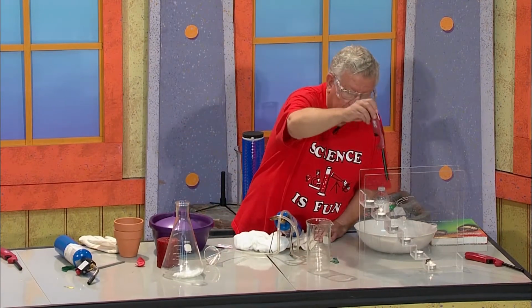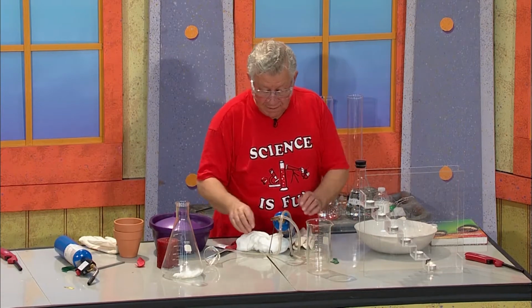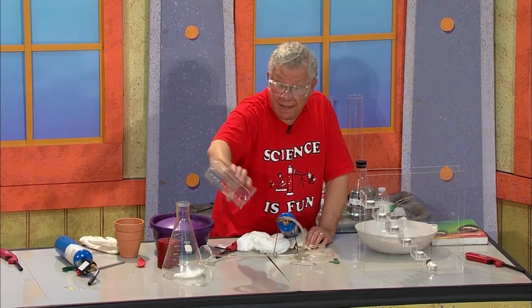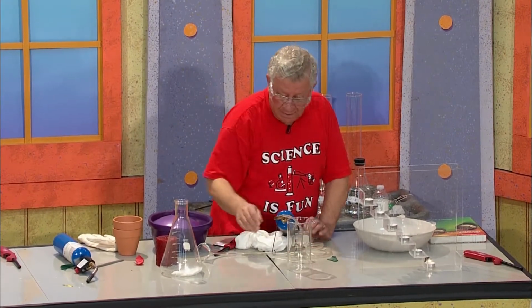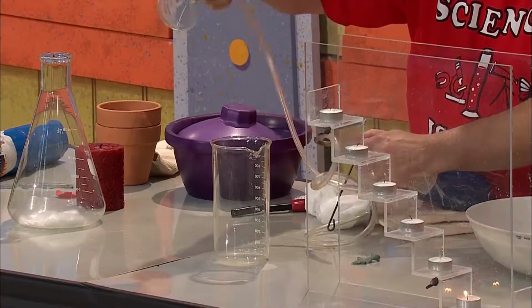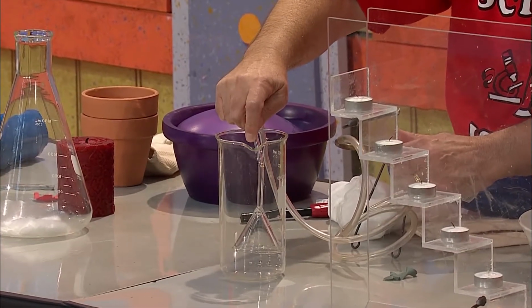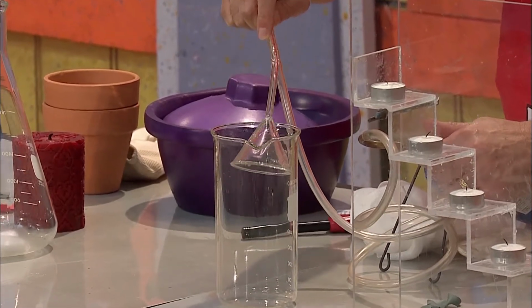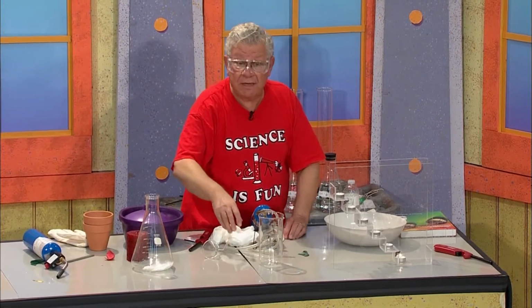We'll put this candle out. I was trying to light up all the candles, but I succeeded in lighting up one. And we want to make sure everything is out of here, right? Including the carbon dioxide gas that formed, right? So it's all coming out. And then I go back and fill the beaker with propane gas. Here we go. And let's try this one in the dark.